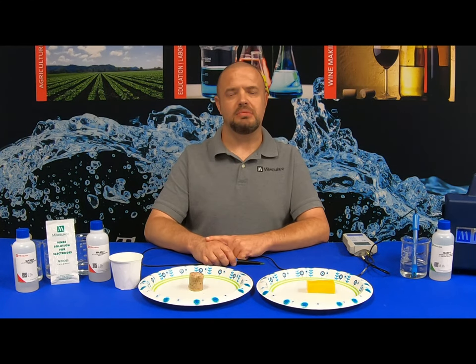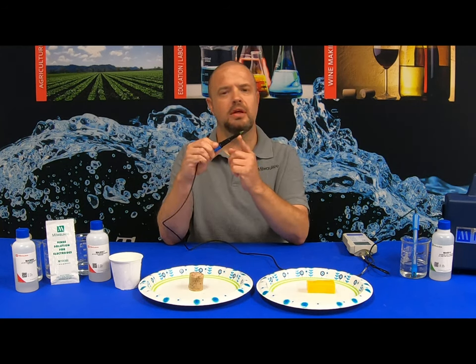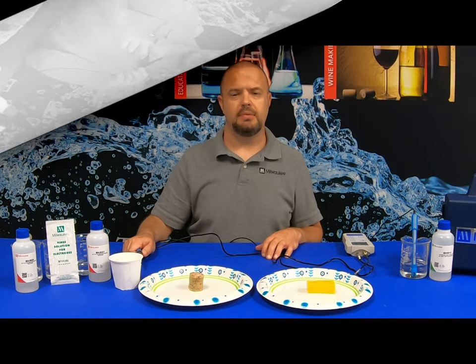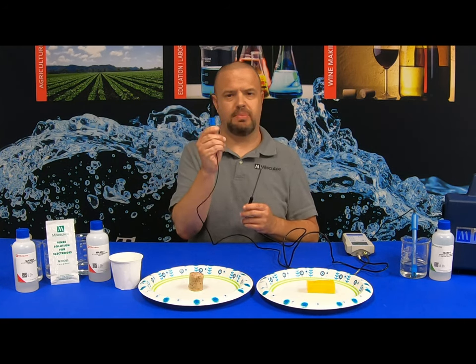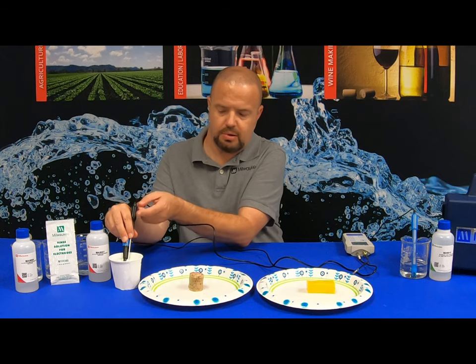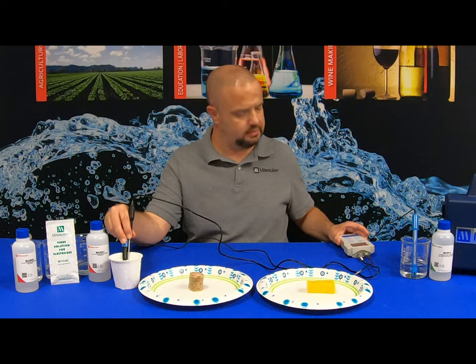The Milwaukee Instruments MA920B1 food probe is designed specifically for meat and cheese applications. It has a cone-shaped tip that enables you to pierce through meat and cheese. Let me demonstrate how to get the pH value of yogurt. Take the MA920B1 pH probe along with the temperature probe, insert them, and wait for the hourglass on the upper left-hand to stop blinking — that's your reading. We have a pH of 4.15.